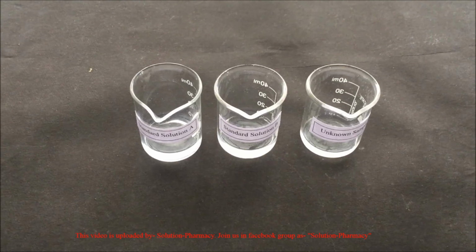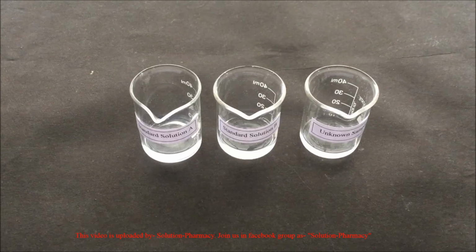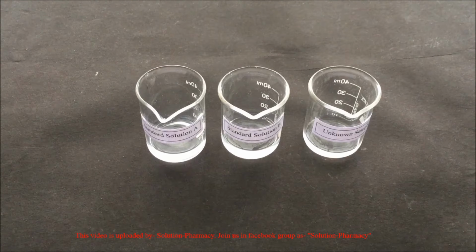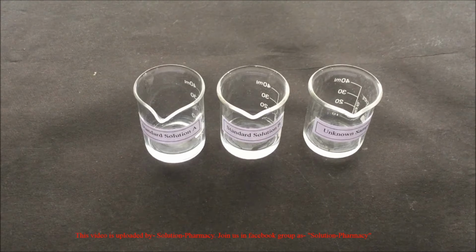Here we have prepared 3 sample solutions of amino acid of volume 10 ml each. Solution A and solution B are the standard solutions of amino acids leucine and valine of concentration 1 mg per ml in distilled water. The third solution is the sample mixture of amino acids which we have prepared for the demonstration of separation by paper chromatography by mixing small volumes of solution A and solution B.